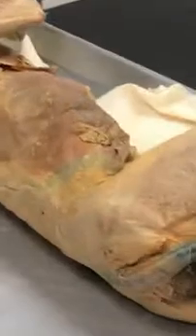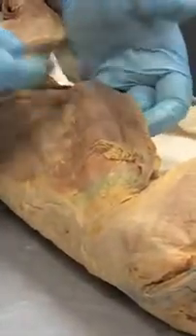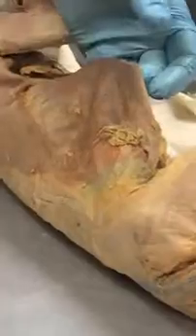We have over here muscle fibers that kind of go this way. If you look at it, you'll see the fibers going this way, like you're putting your hands in your pockets. Right? They're on an angle, thus the name oblique, and they're on the external area. So what is this called? External obliques. There's reasons why they're being called that, right?